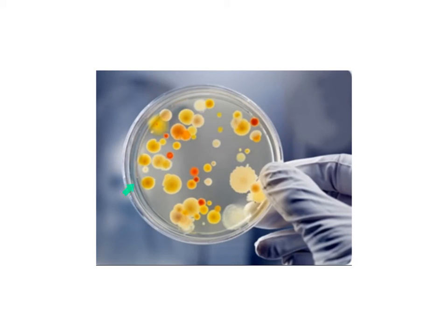Here we have one where we can see a multitude of airborne contaminants and various bacterial species. This would not be a quality petri dish to work with in identification of a bacteria for a disease. We would want to take a bacteria from here and grow a pure colony on an agar plate.